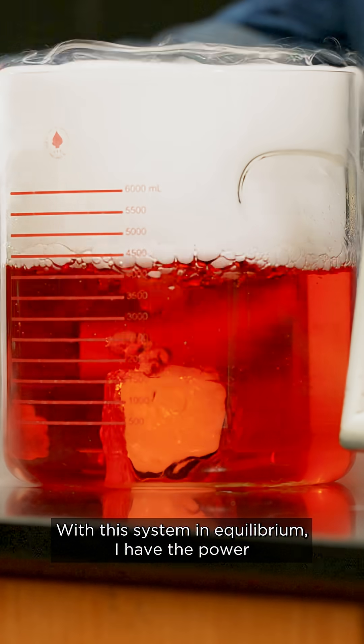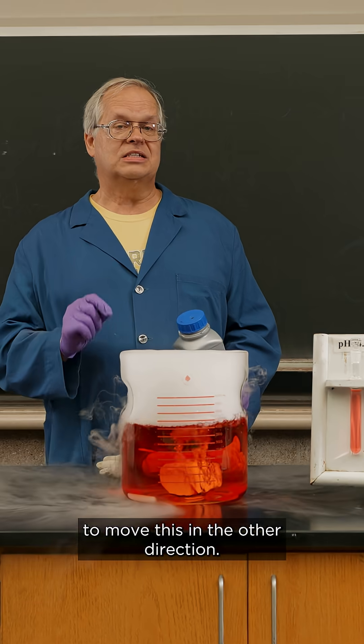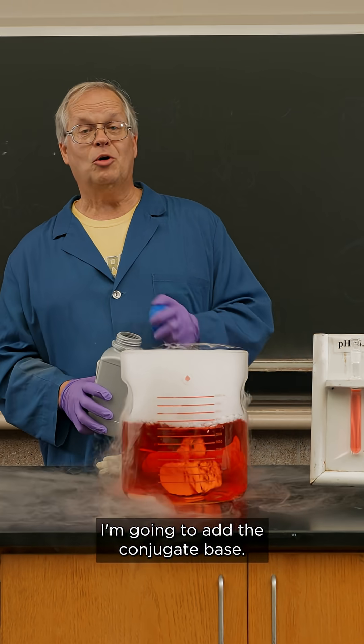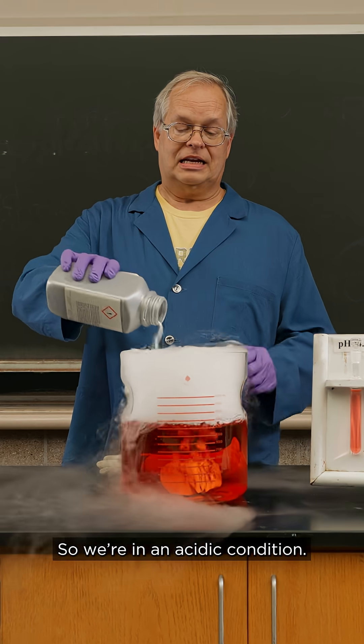With this system in equilibrium, I have the power to move this in the other direction. I'm going to add the conjugate base. So we're in acidic condition.